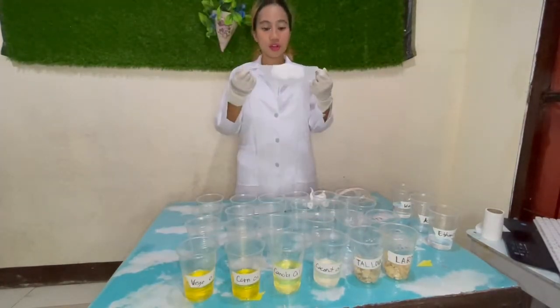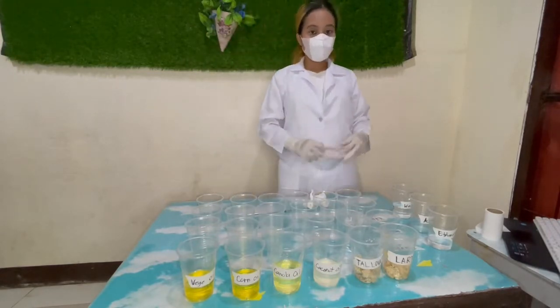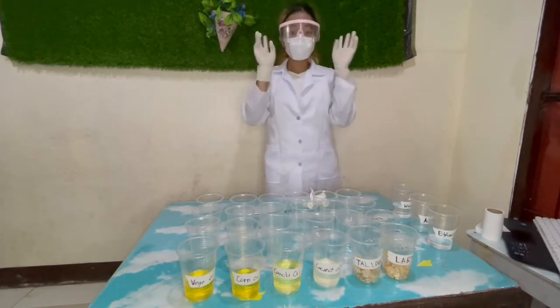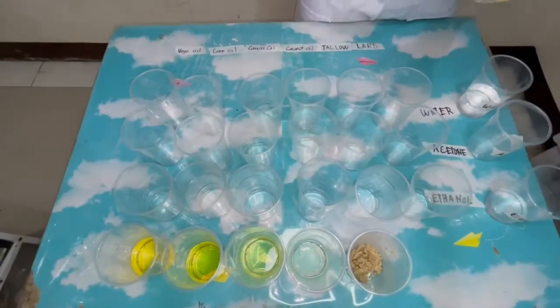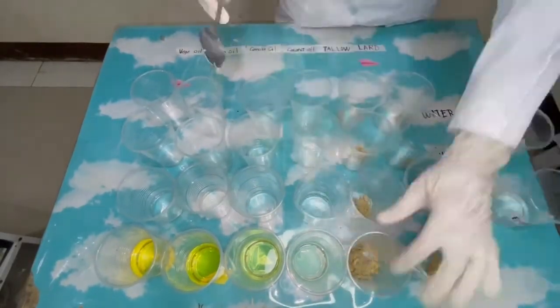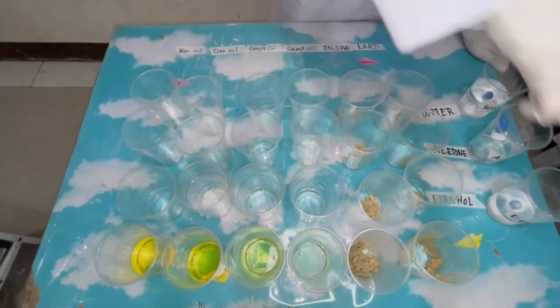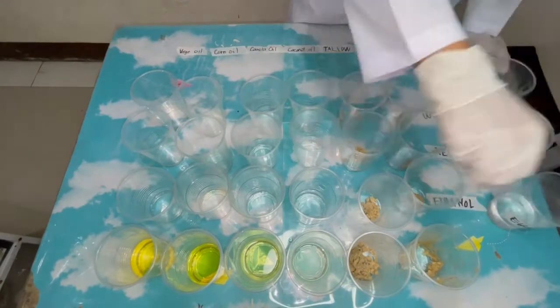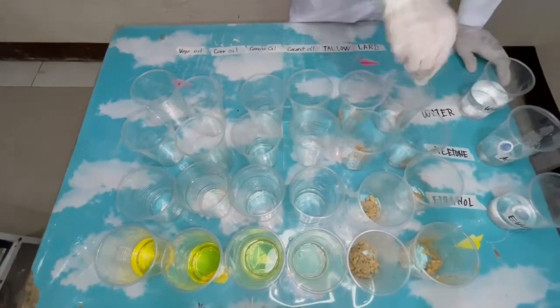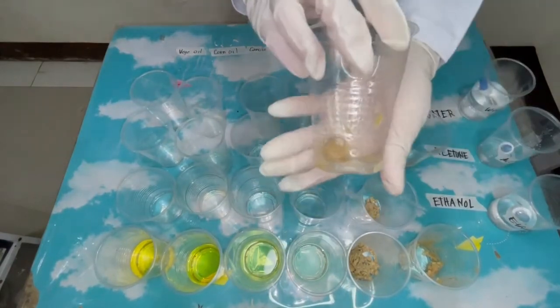Since we are done checking the physical properties of the substances, let's put back on our safety goggles and safety masks to continue our experiment. For the solubility test, let's place 1 ml of the substance into a small transparent wide-mouth container and add 3 ml of the solvent. Shake well and note whether the sample is soluble, slightly soluble, or insoluble.